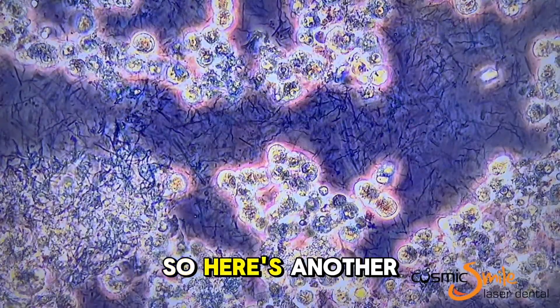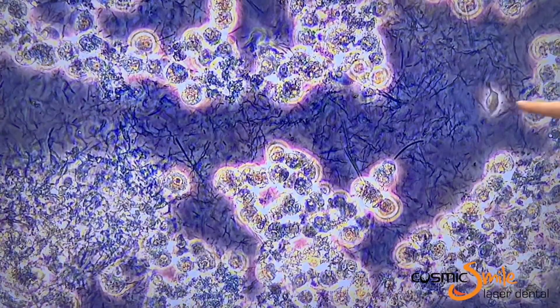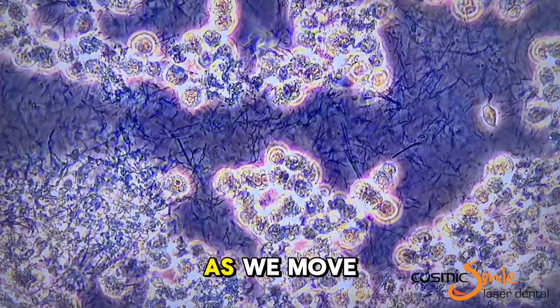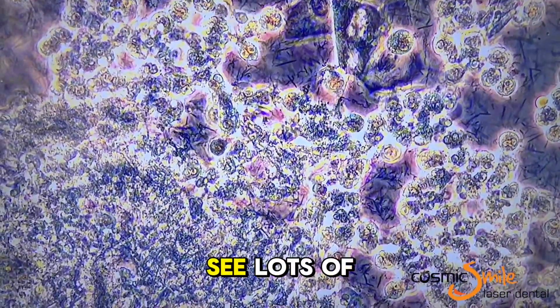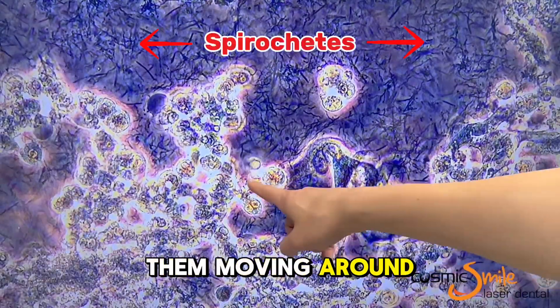Here's another example of the trichomonad. As we move around we can see lots of examples of them moving around.